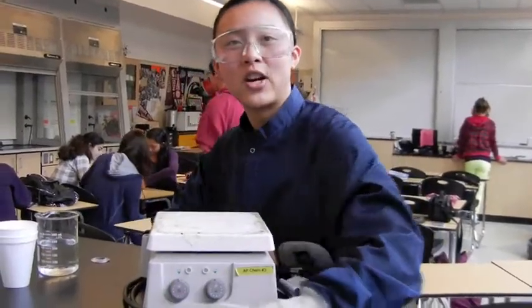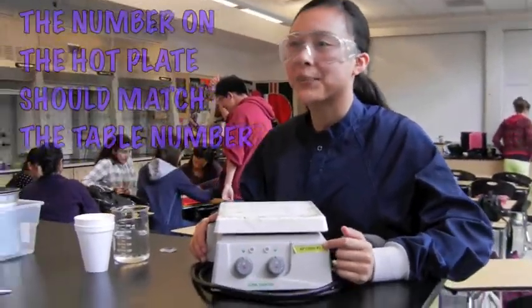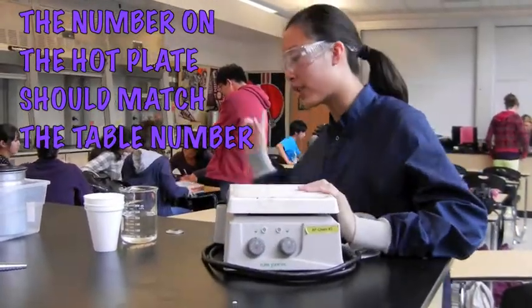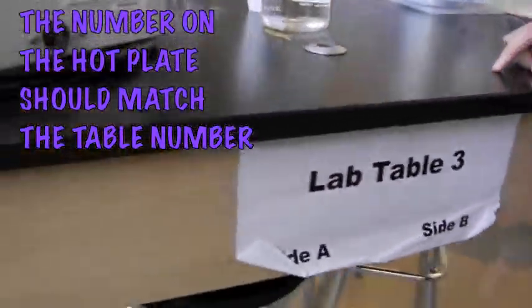So in this portion we're going to be talking about the hot plate. You'll notice that it's number 3, and Ms. Bauman likes it, or it's better, if the number for the hot plate matches the table number. Table 3.